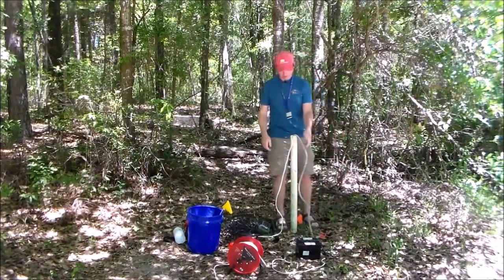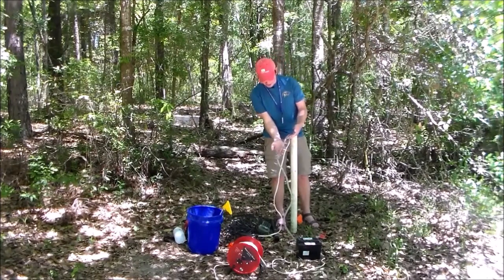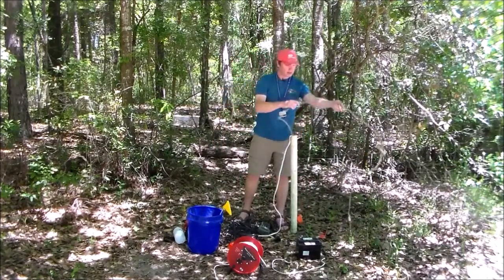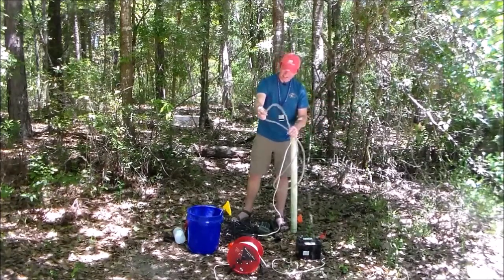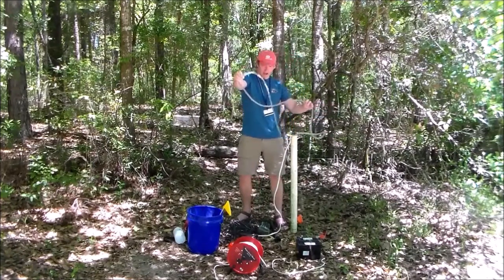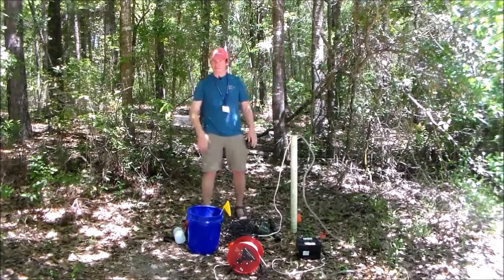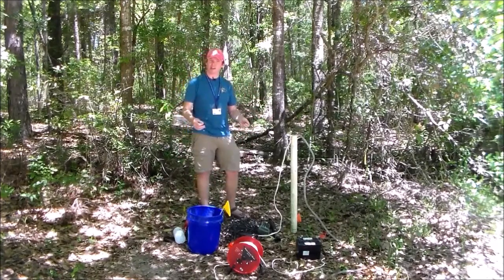Here comes the water. So maybe you'll see it in the video, I'm not entirely sure, but right now it's coming through with kind of a tannish color to it. There's a little bit of sediment in there, it appears to be. And it's already starting to clear up very quickly. So this well gets used often enough for hydro class. I'm pumping water through it quite frequently. That's going to keep that silt constantly flushed.